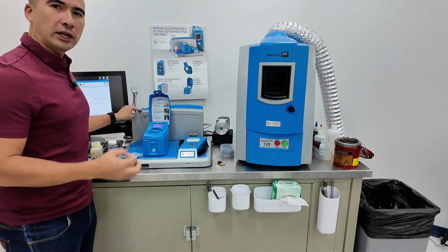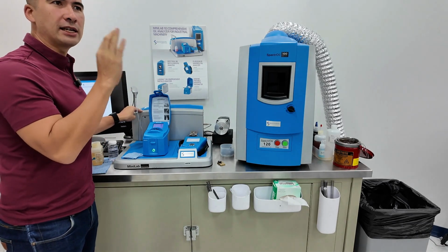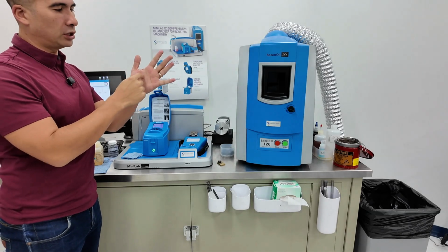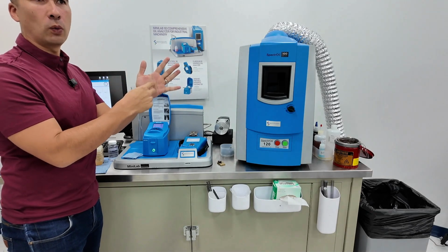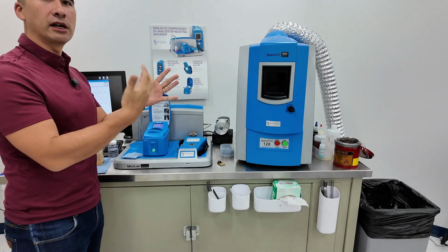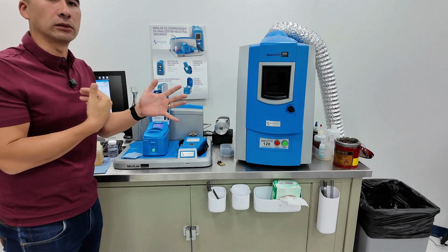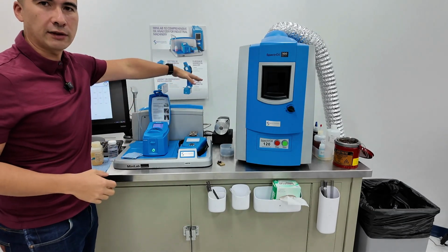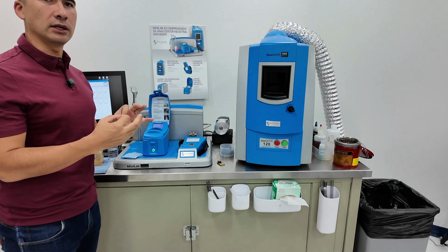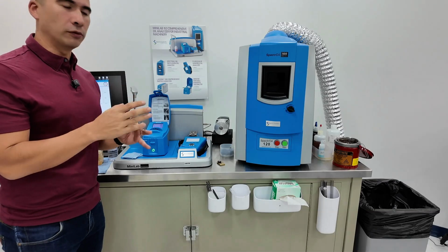With LaserNet Fines, we actually have an optical camera inside taking images of the flow stream as it goes through. Based on the shape and size, we can get a particle count, but we can also identify water, for example, and remove that from the particle count. That's the advantage of LaserNet Fines. On top of that, it can also characterize some of the actual particles themselves, based on the shape and morphology.